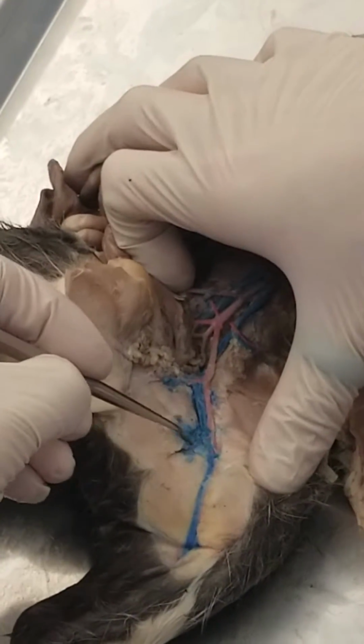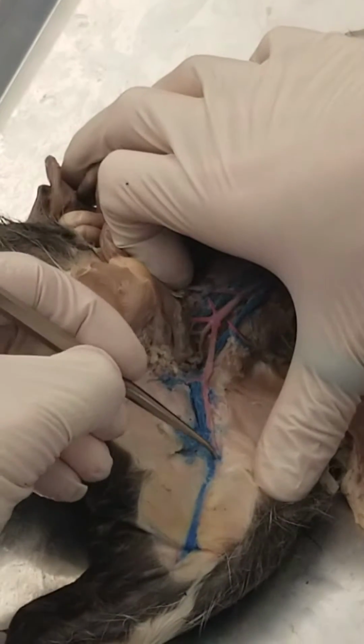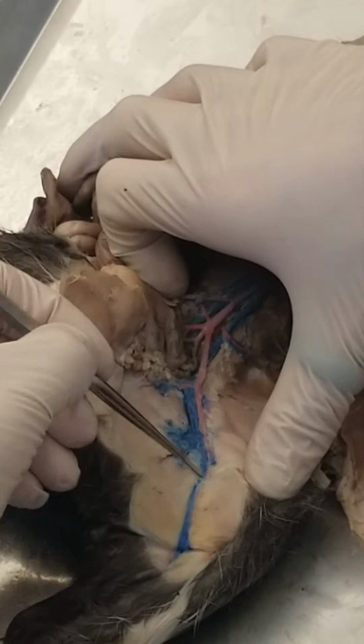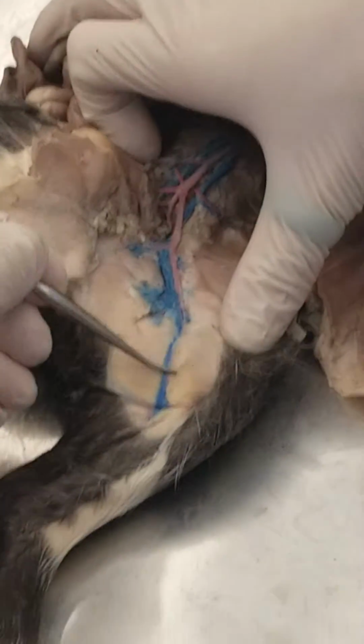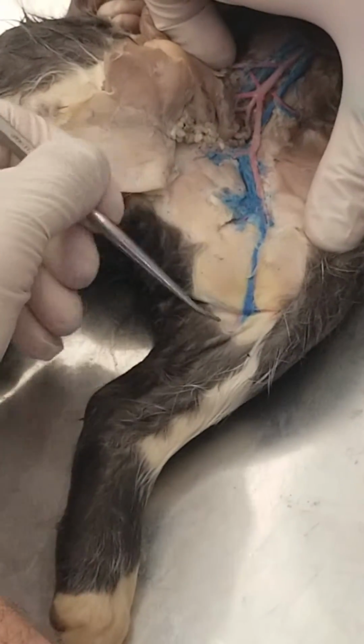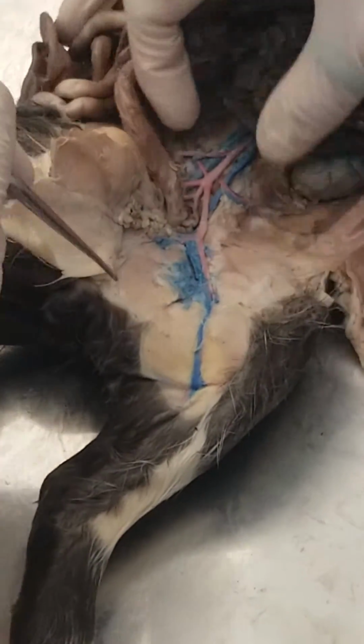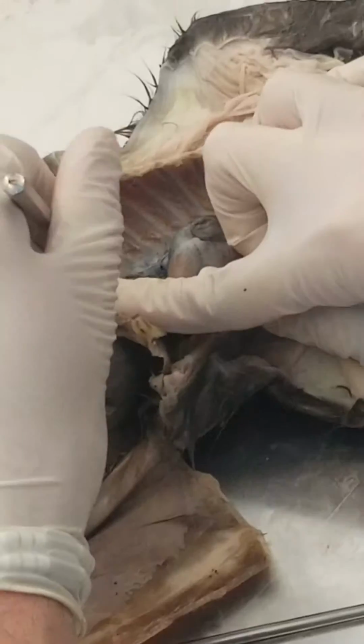Here, this is where your femoral starts, and your deep femoral goes in here where the deep femoral vein and artery is. So deep femoral vein, deep femoral artery. And then your great saphenous is pretty much all of this. Okay? So the femoral is actually over here, but you can see it's popped because the blue dye is coming out.